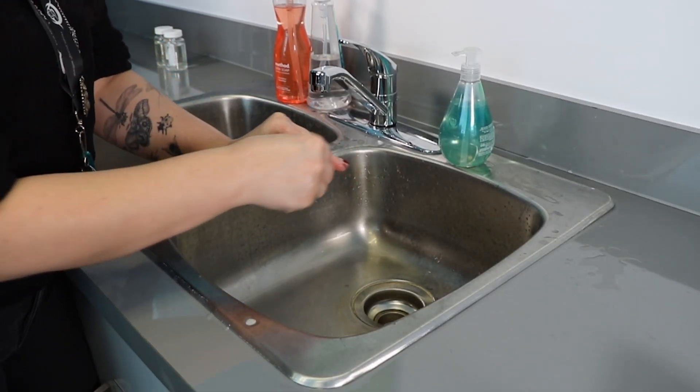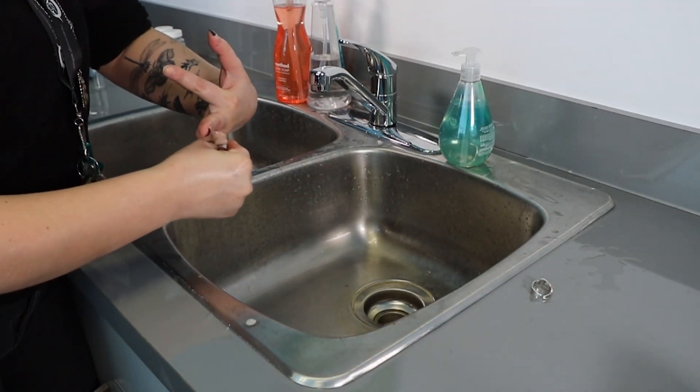Wash your hands or use an alcohol wipe or hand sanitizer if you can't wash with soap and water.